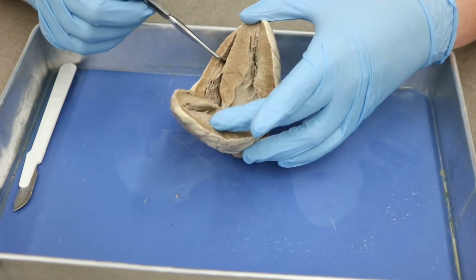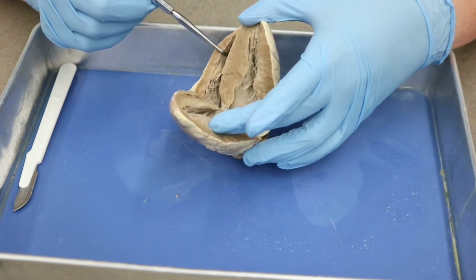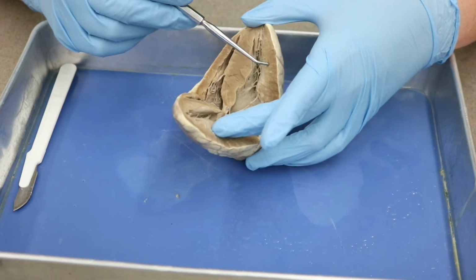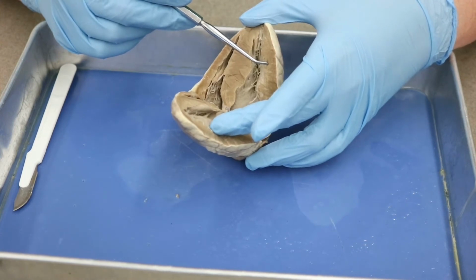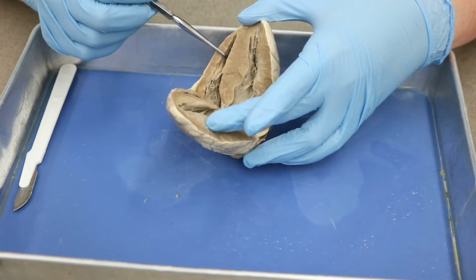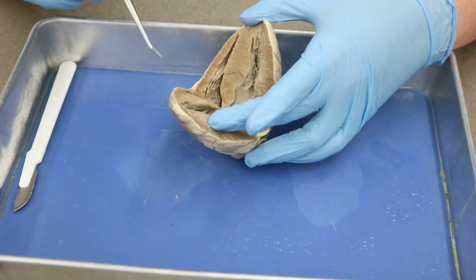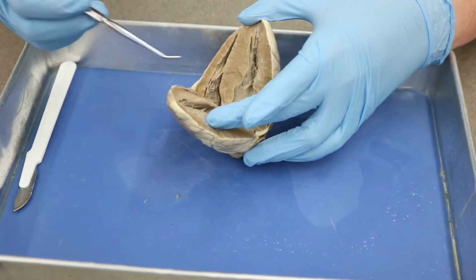Good. So the thinner walled ventricle is going to be the right ventricle, because the right ventricle only has to pump into the pulmonary circuit, whereas the left ventricle has to pump into the systemic circuit. So it has to be able to pump blood all the way to your toes and all the way up to your brain. But the right ventricle only has to pump to your lungs, which isn't very far. So because of that, the muscle is much thinner on this side than it is on this side. Okay, so if you were in doubt when you were looking at the external surfaces, this is the quick and easy way to make sure that you are correct.